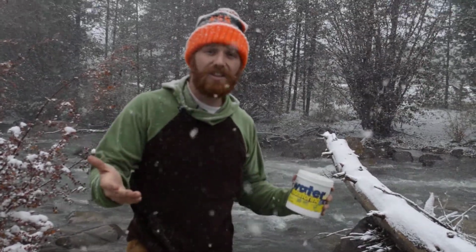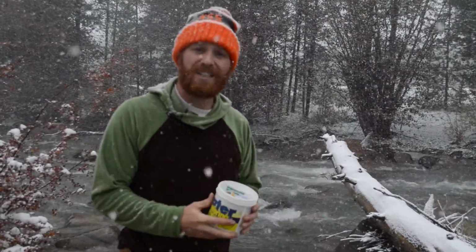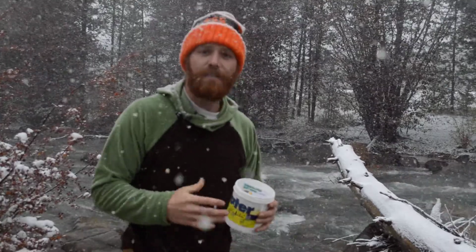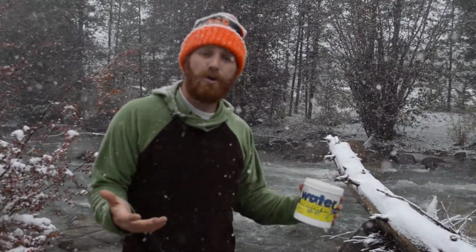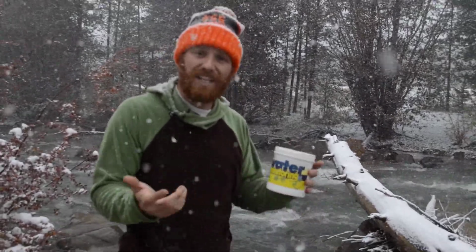Alright, so we're back here at the Snake River, and I'm going to tell you guys about a few physical and chemical tests that you're going to do also while you're here, along with the biological. The first one that I'm going to talk about is turbidity. So turbidity is how clear or cloudy the water is. We're going to use this tub to test for turbidity.